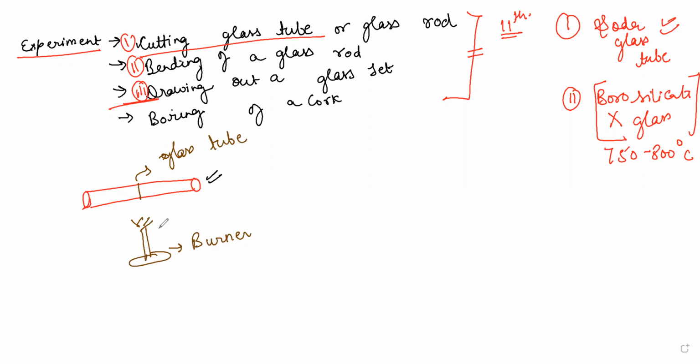Just provide it with the heat and make sure you are rotating it appropriately, from the sides, heating it around this mark. After heating it, just turn off the burner. Now we don't require it. Now this will be cut from here with a scratch mark, which will be made with a triangular cutter.